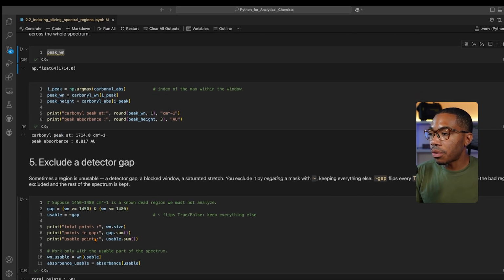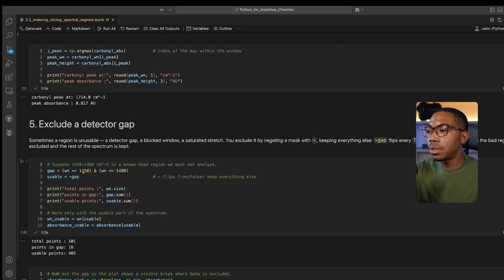And then we can do all sorts of other things by trying to use this wavelength argument to put in or identify gaps if, say, the detector goes out, all sorts of ways that we can extend this logic to many other circumstances from our instrument data or laboratory experiments. And so this ability to move through the data and understand if we're using the Python generic indexing or a chemistry relevant indexing, whether that's time from a chromatogram or wavelengths or wave numbers, it doesn't matter. But it's important to understand what is the indexing criteria and then adapt that back into the chemistry domain.